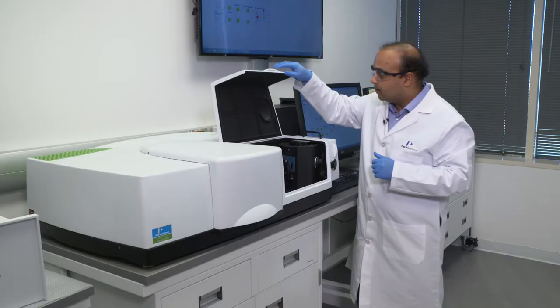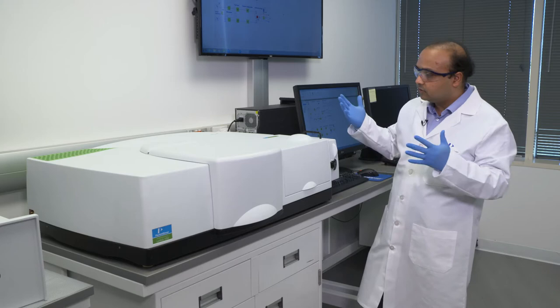Close the instrument, and then hit go on the software. Essentially what the software will do is take a scan of the sample within the wavelength range that's specified and measure the contribution, measure the transmittance value from these samples.